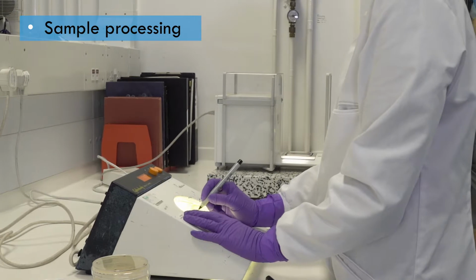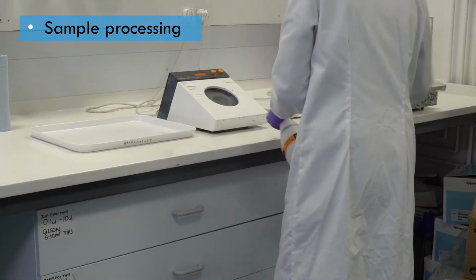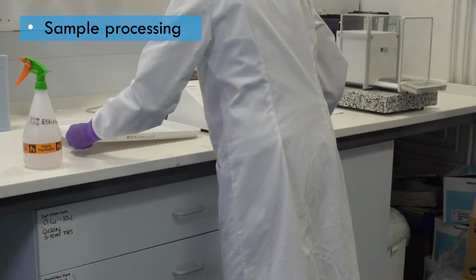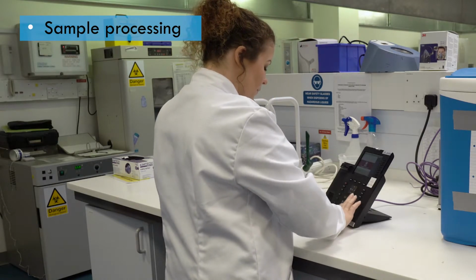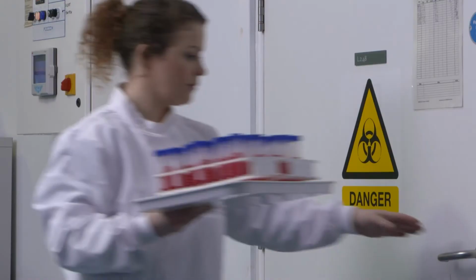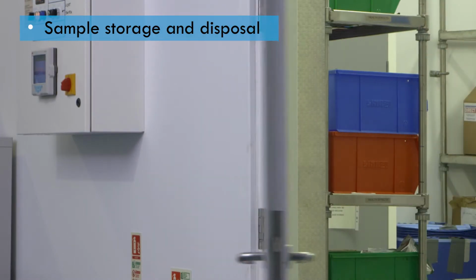When you've finished the procedure, you should tidy up and clean the area before moving on to the next process. To avoid confusion and misplaced samples, clear communication with colleagues will be required before sending the sample to a different department.